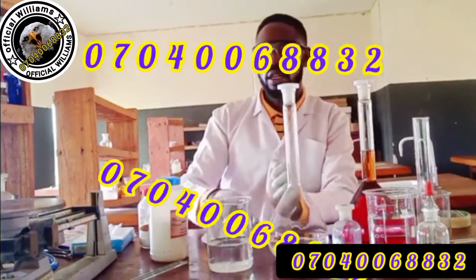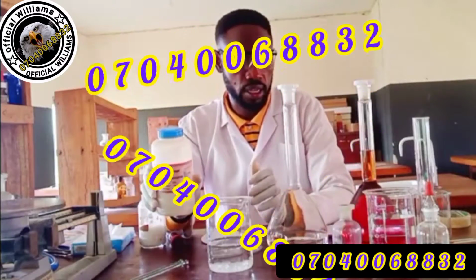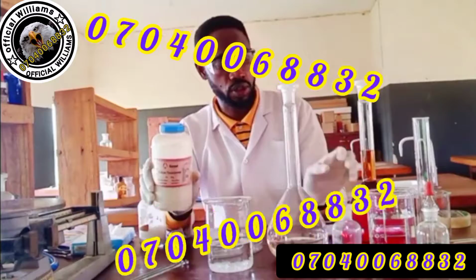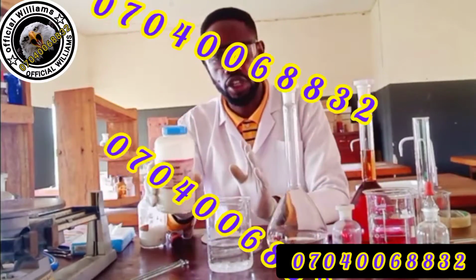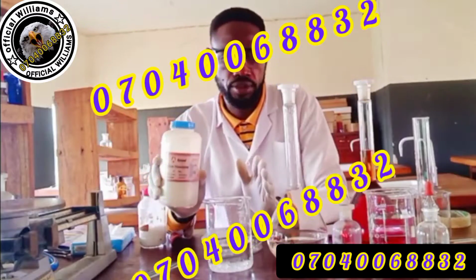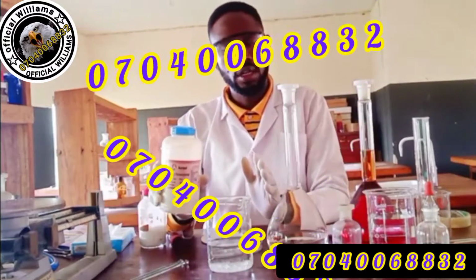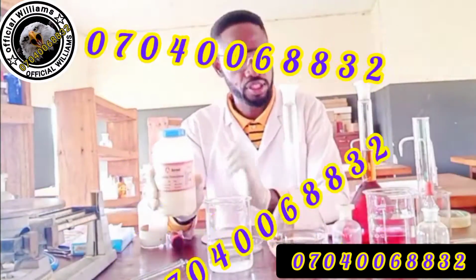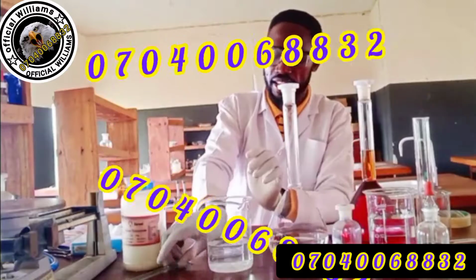And again, this sodium thiosulfate is efflorescent, and it is also sensitive to the environment, just like iodine, but it's more stable, far more stable than iodine. So you have to check the one you are using if it is up to pentahydrate. If not, there will be big error for your school. So you buy from me if you need an accurate result. Thank you. So I've added this here.